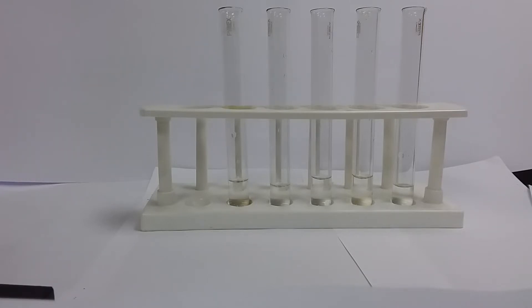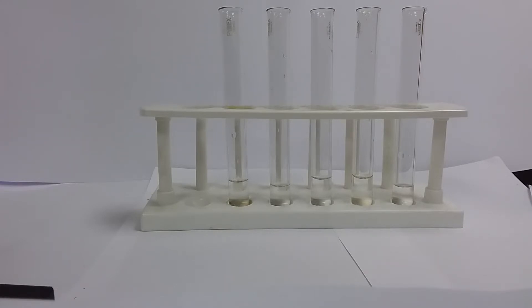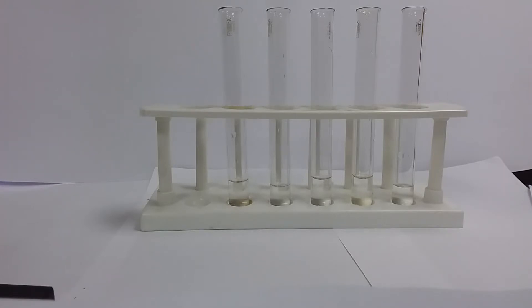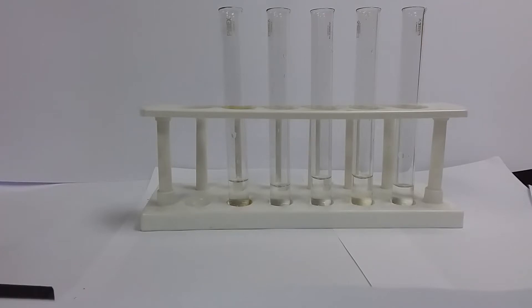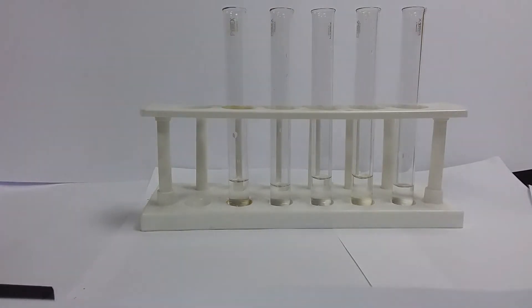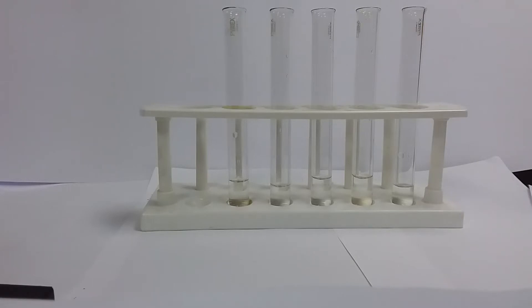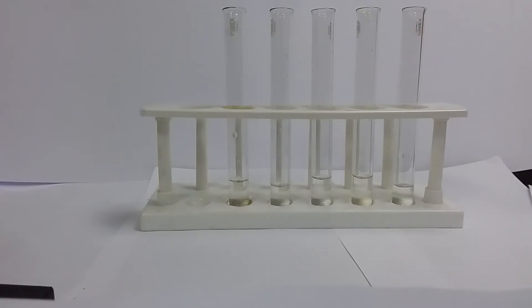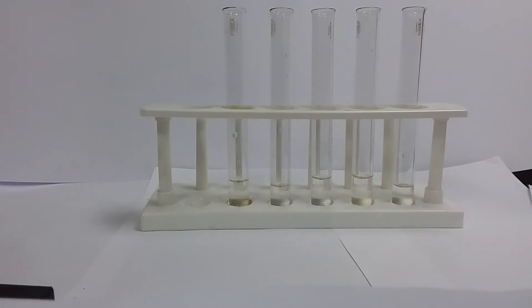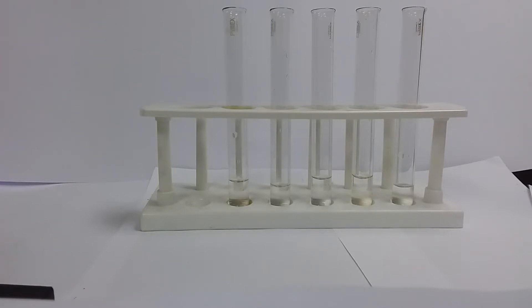Our preliminary observation is really just looking at what our salt or solution might look like. Based on our preliminary observations, we may be able to make some initial inferences. These are what we describe as colorless solutions. This is clear and it is colorless — clear because it is a solution, and colorless because there is no color. We will see in another example that some of our solutions are colored.